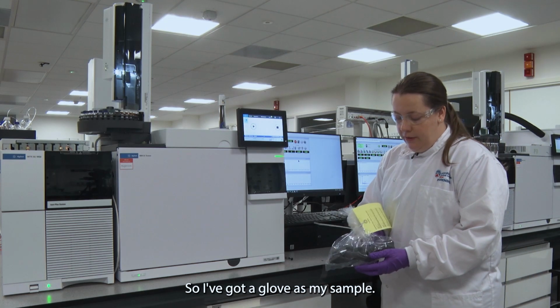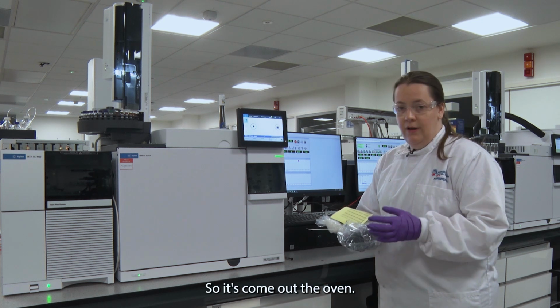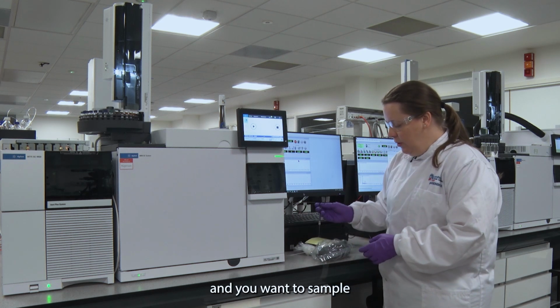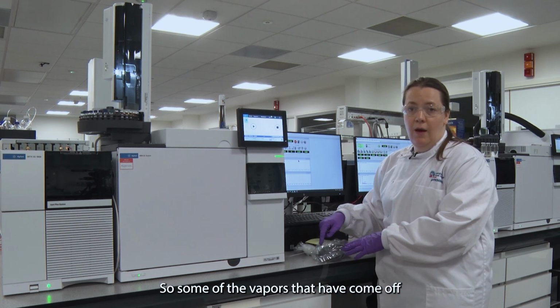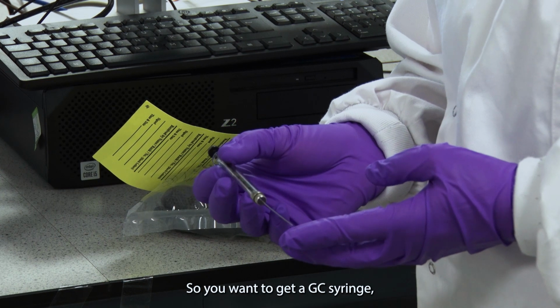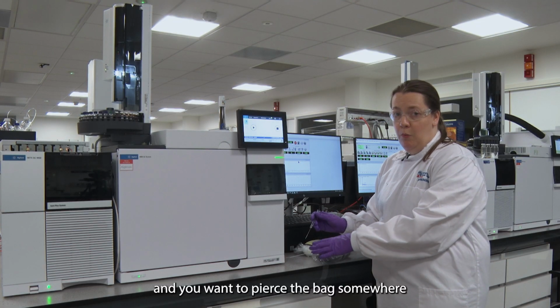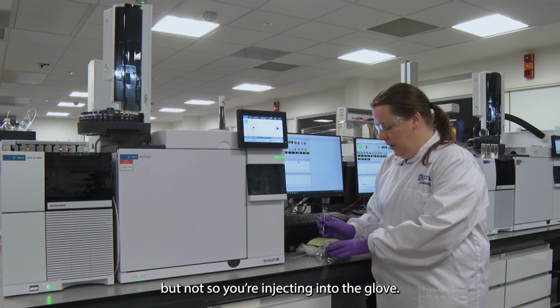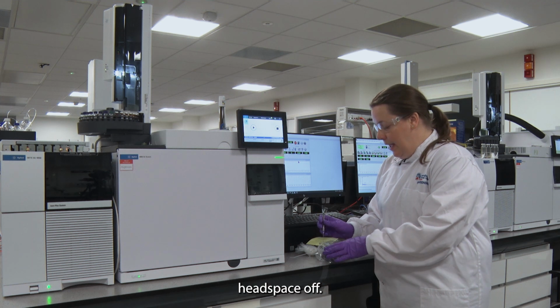So I've got a glove as my sample. It's come out the oven, it is a little bit hot. So you put it on the bench and you want to sample some of the headspace, so some of the vapours that have come off the glove. You want to get a GC syringe, which is a sharp needle, and you want to pierce the bag somewhere near the glove but not so you're injecting into the glove, and you're going to take 200 microlitres of headspace off.